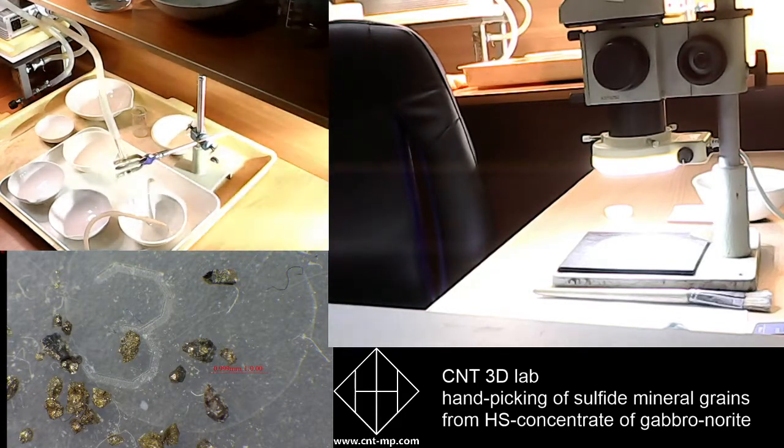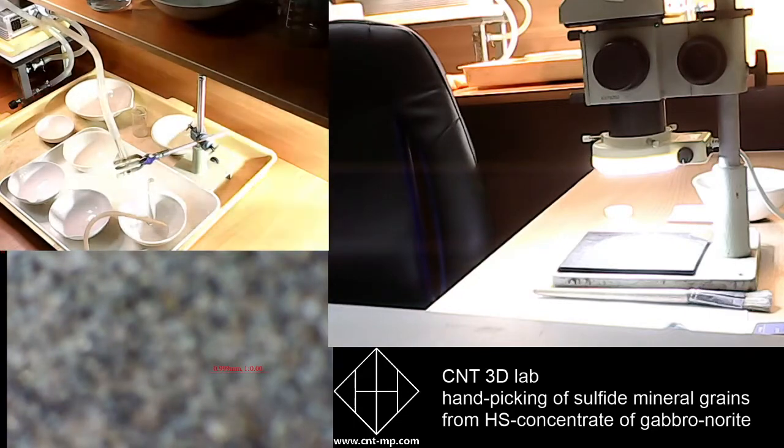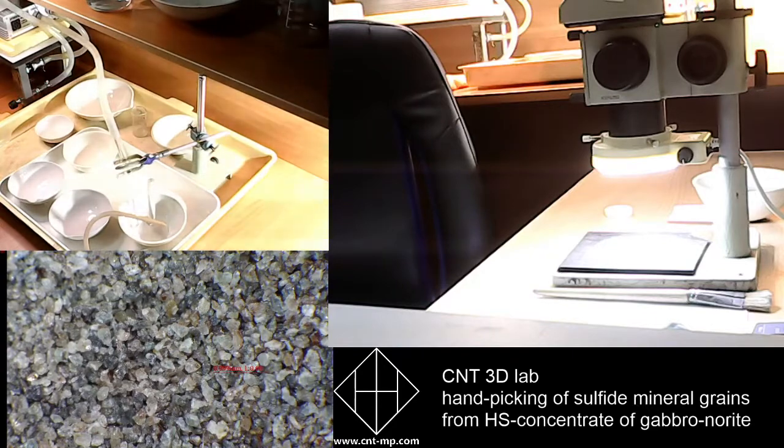So let me show you once again the light fraction to show you the difference of product we received. There are no grains, no sulfides, no intergrowths with sulfides. There are only light minerals like quartz, amphiboles, and etc.